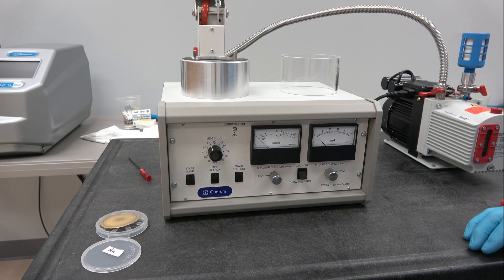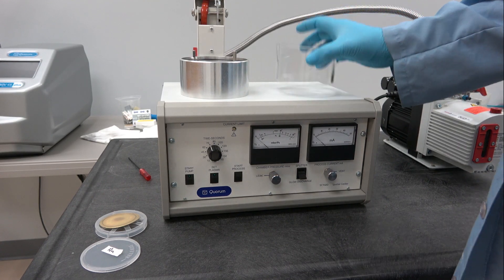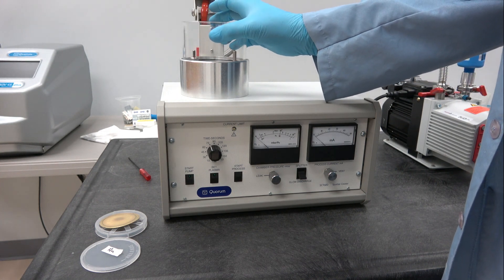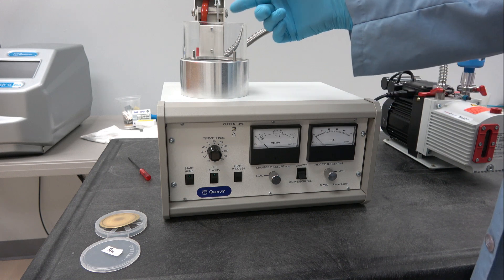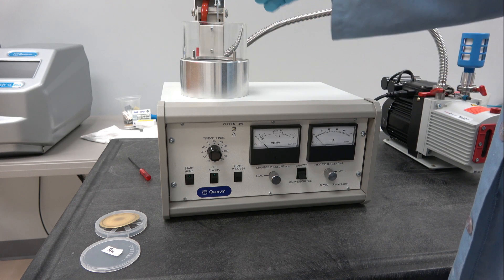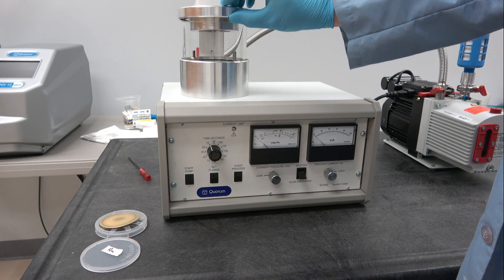Once the target's installed and you've attached argon gas, you're essentially good to go. You can put the glass cylinder back in place, put your sample inside and close the lid.